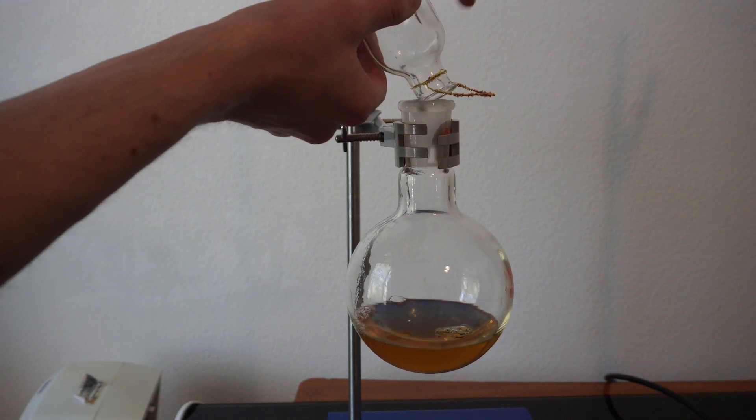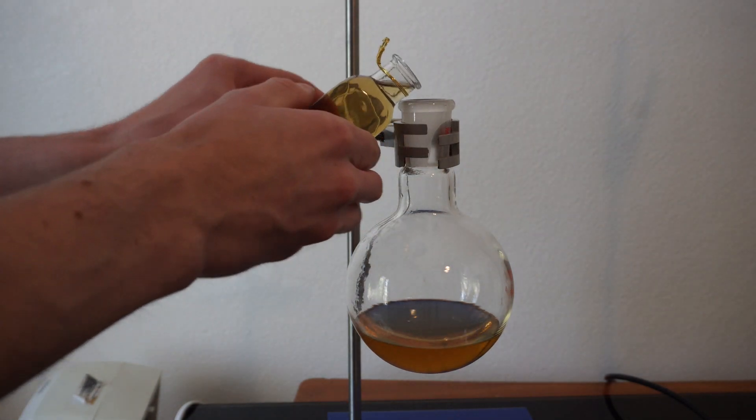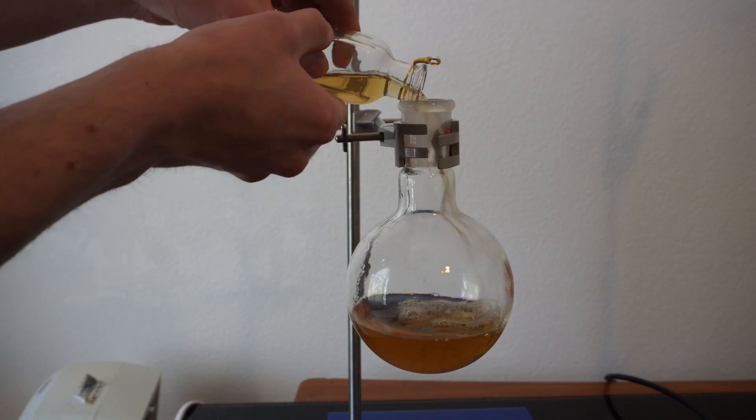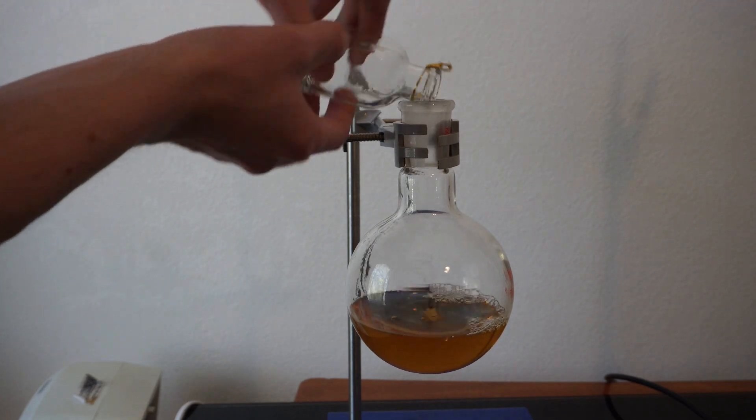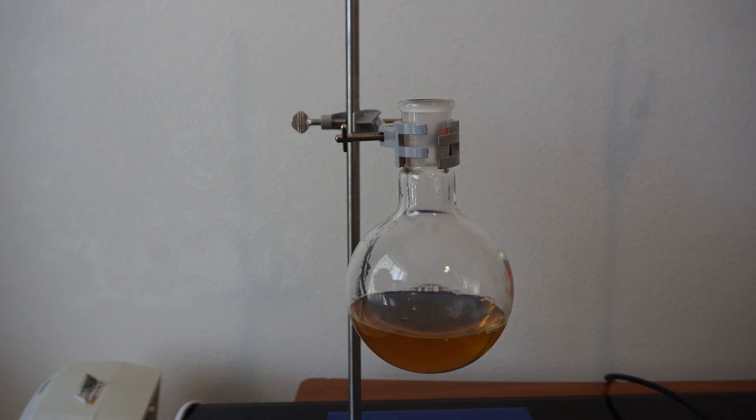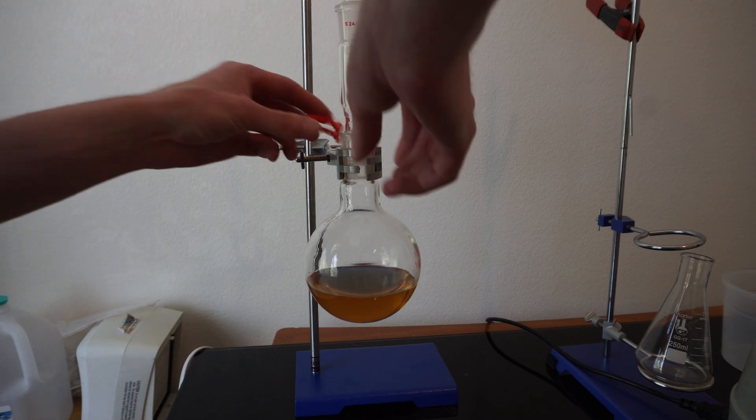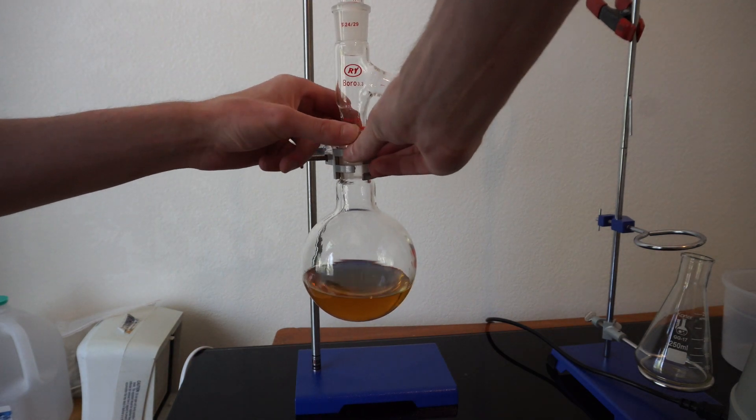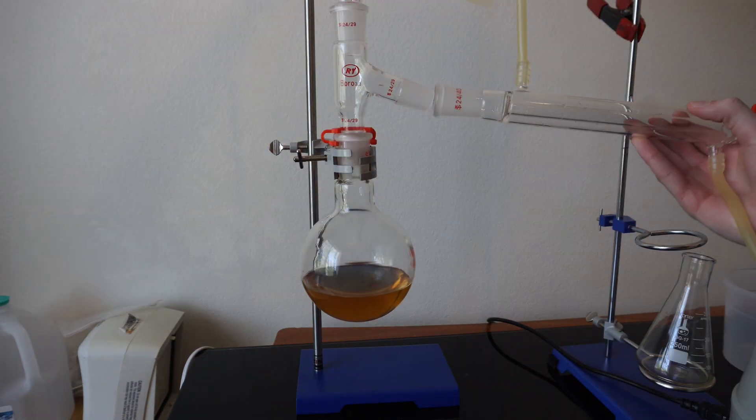So, I will add all three vials into the boiling flask. Followed by setting up my still, we're using a thermometer to check the vapor temperature to see when all of the H2O is evaporated.